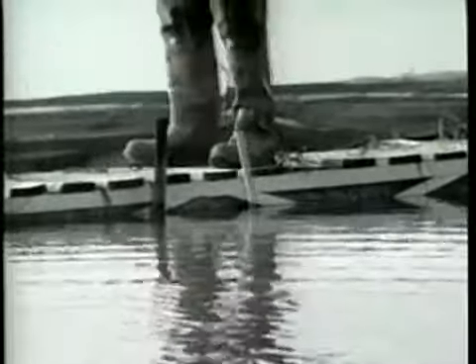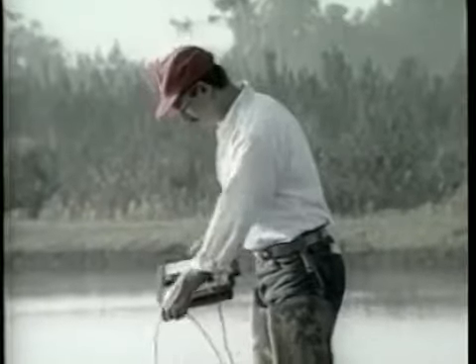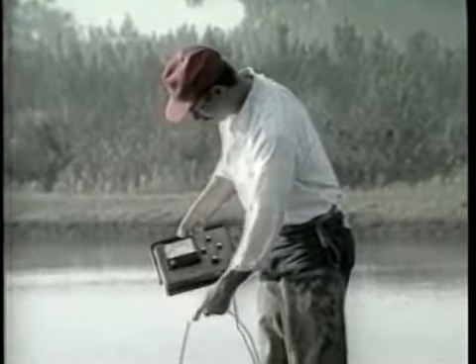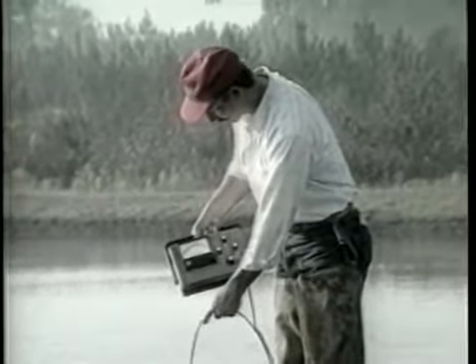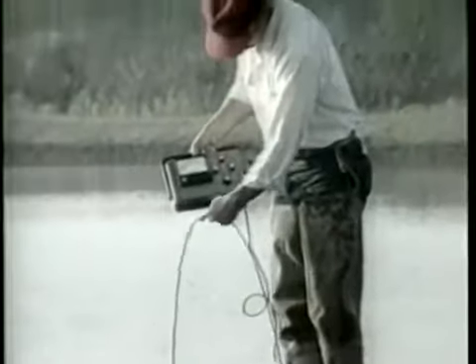Remember to take the reading away from the pond bank, aerators, incoming water, algal blooms, and if possible, with the wind at your back. Submerge the probe about 1 foot below the surface. To get an average value of dissolved oxygen for your pond, it is a good idea to sample at several different locations, whether you use a kit or a meter.